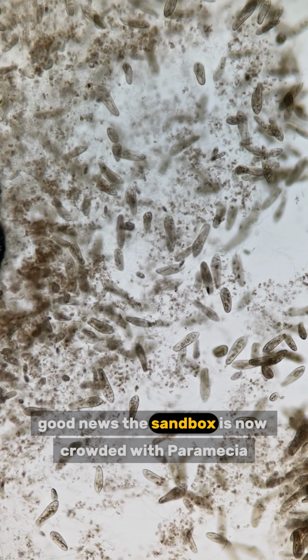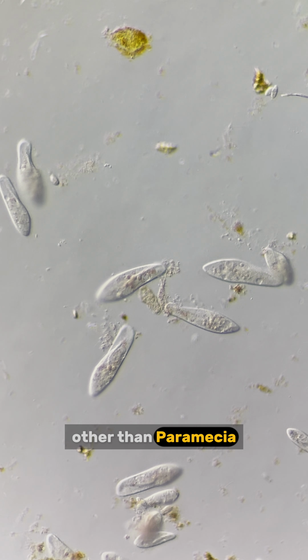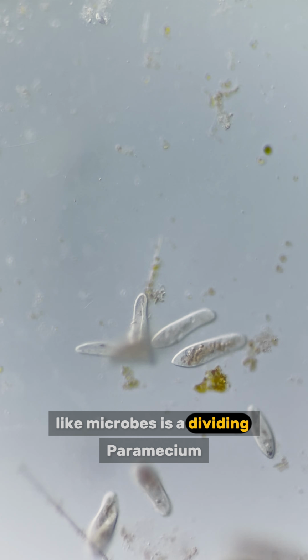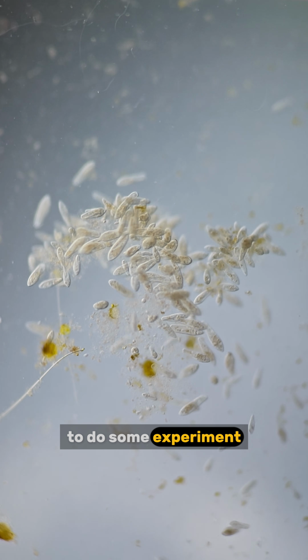Good news, the sandbox is now crowded with paramecia. The bad news is that I hardly see any microbes other than paramecia. Natural selection chooses paramecia to survive. Now I can confirm that the boomerang-like microbe is a dividing paramecium. Anyway, it is a good chance to use the high paramecia density to do some experiments.